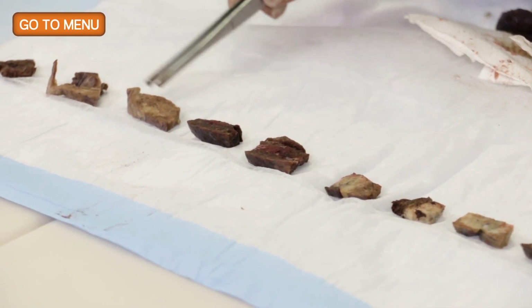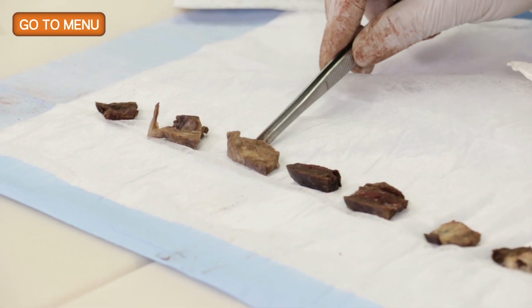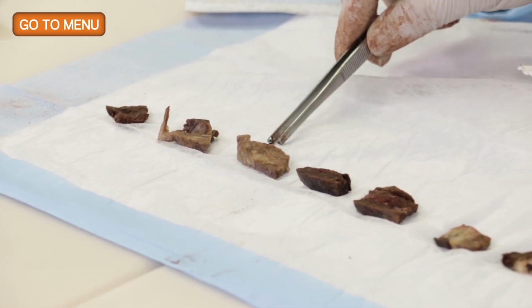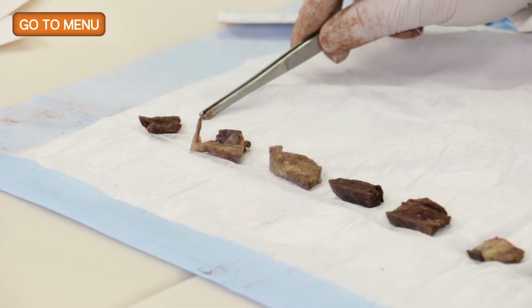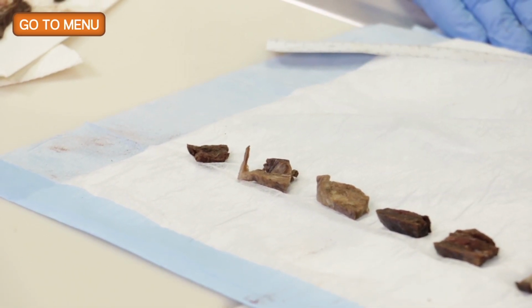And then we have 2 additional sections of uninvolved lung parenchyma that's distant from the tumor, as well as the hemorrhage, of course. And then we found another area of suspected hemorrhage, so we've also made an additional submission.